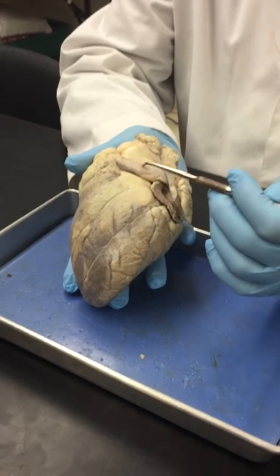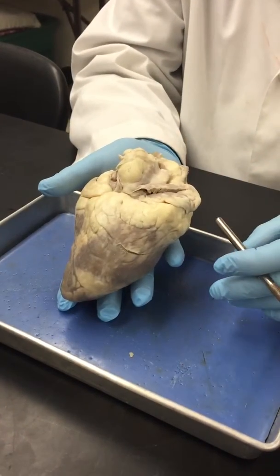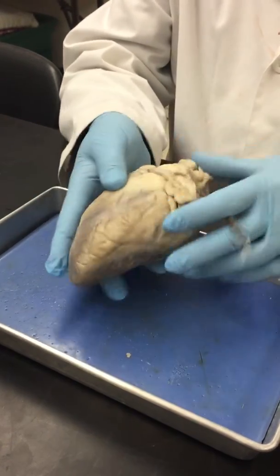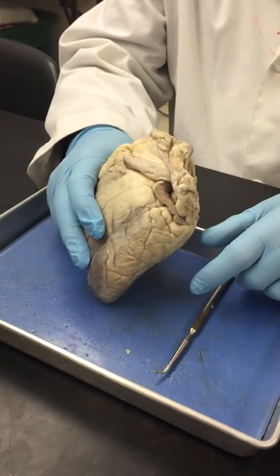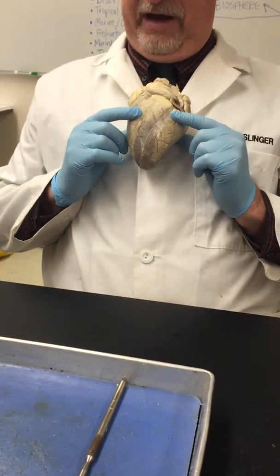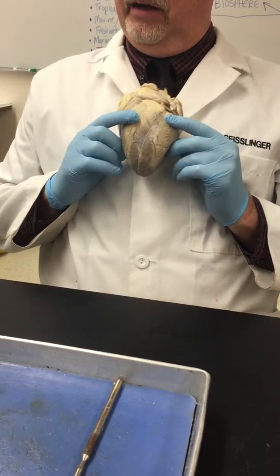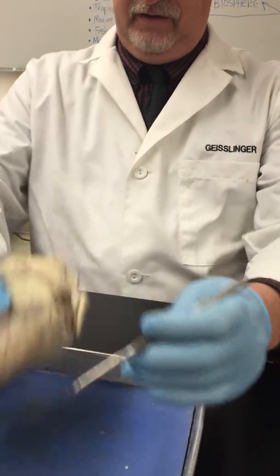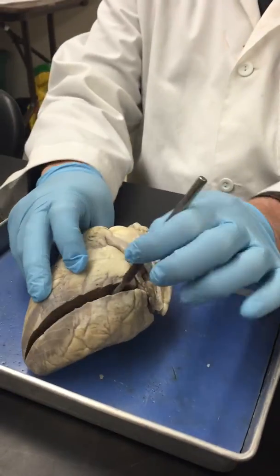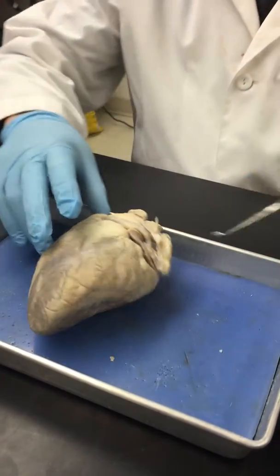All right, this is the ventral surface of the heart, and I know this because on the ventral surface you can see this is the pulmonary artery. You can't see that on the dorsal. Just be aware that this is as if you're looking at my heart, so your left is its right. So when I ask on the practical, what chamber is this? It's not the right ventricle, it's the left ventricle, okay?